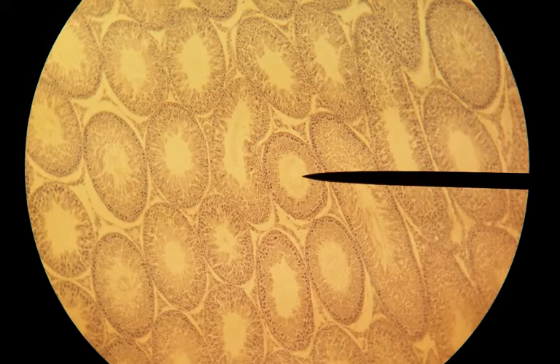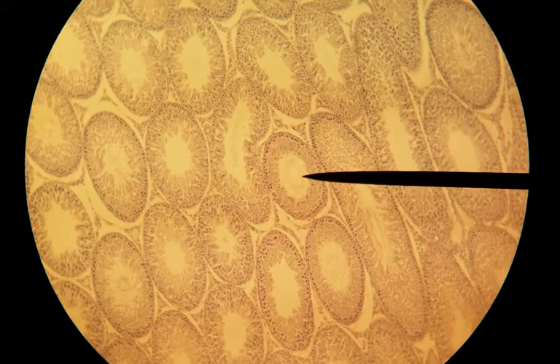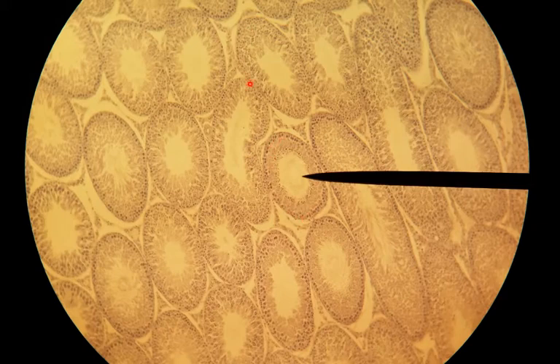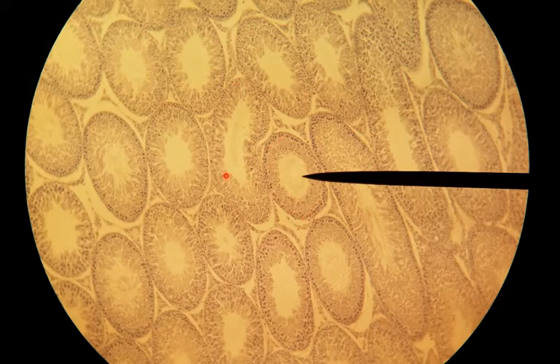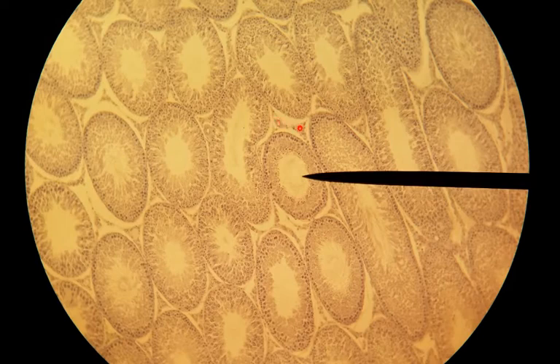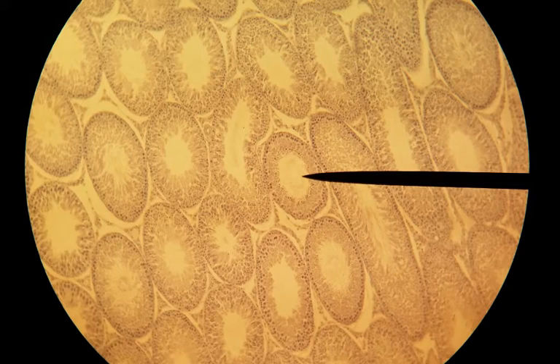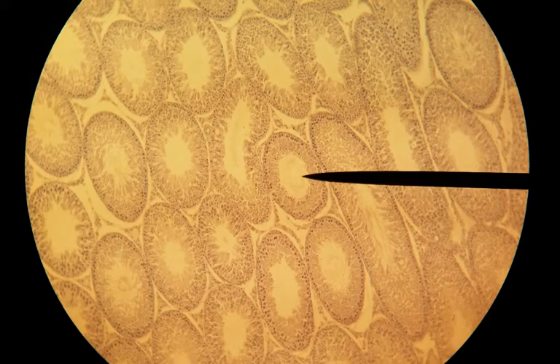In between one seminiferous tubule and the others, sometimes you'll see this loose tissue. These are called Leydig cells, or interstitial cells. These are the cells that produce testosterone in males.